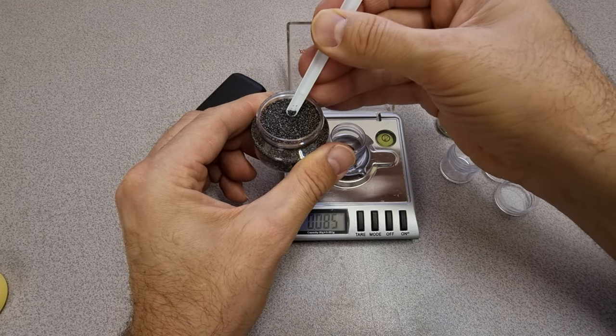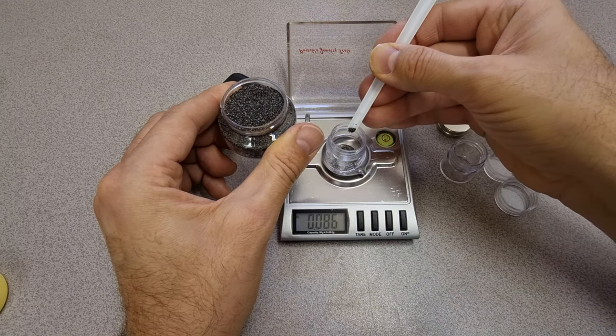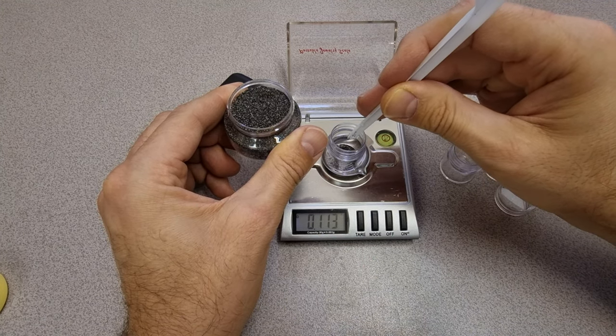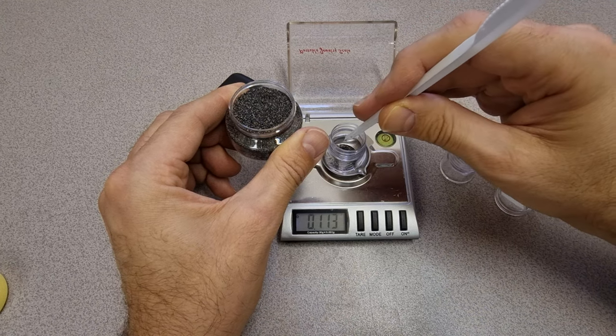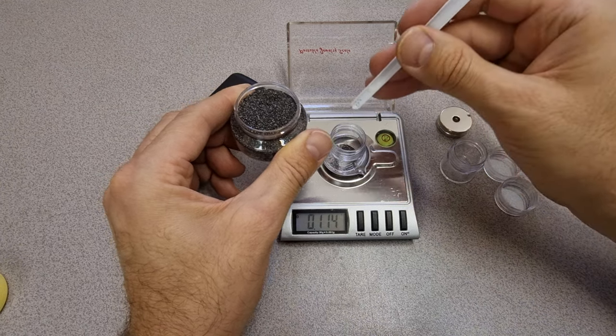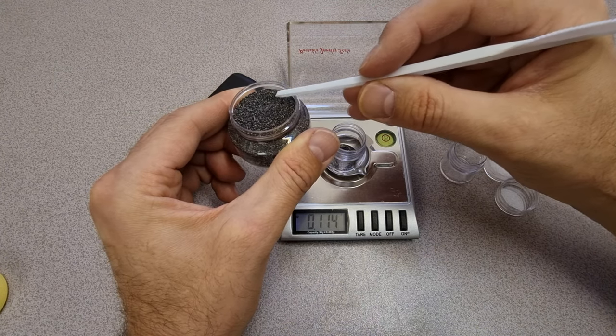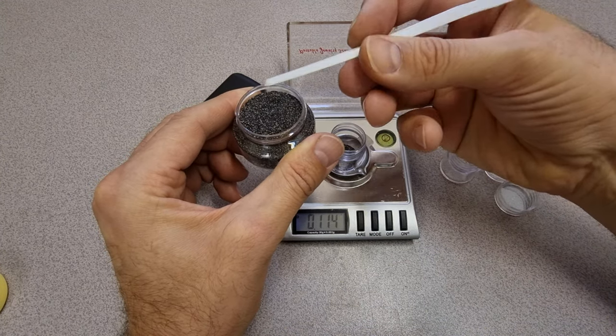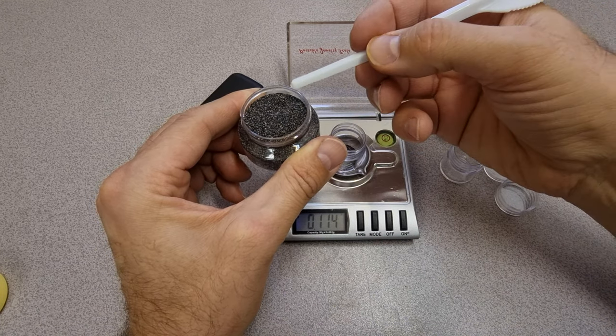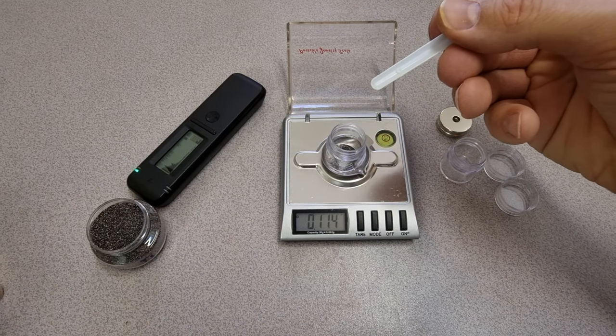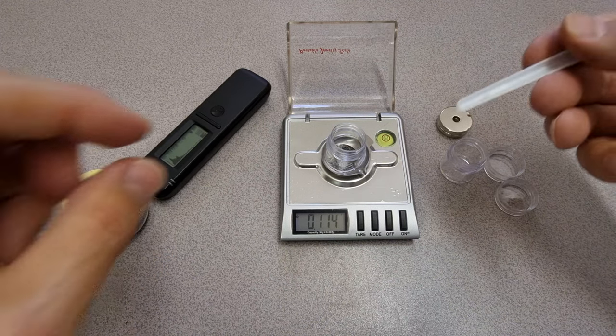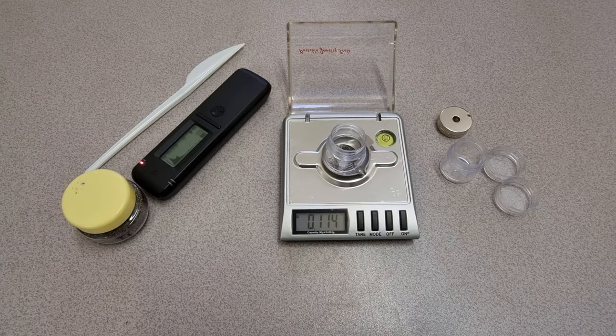So let's try and make this to keep the maths easy. Looks like about one-eighth of a gram there. It's nice having something black on something that's white. That's that over there. Put that back. It can bleep away as it likes.